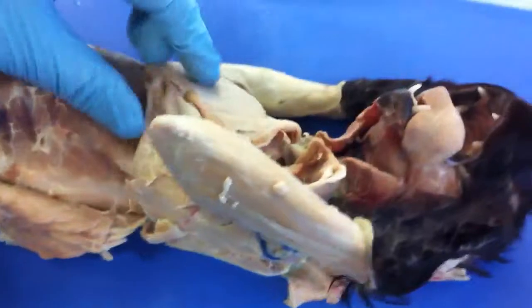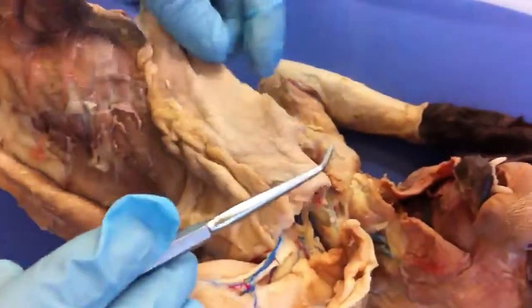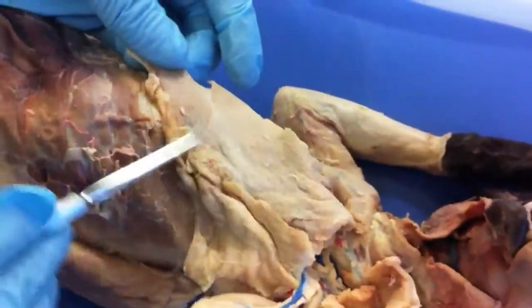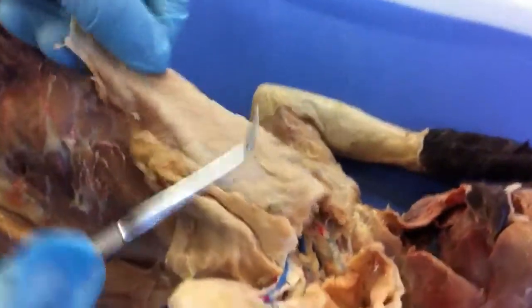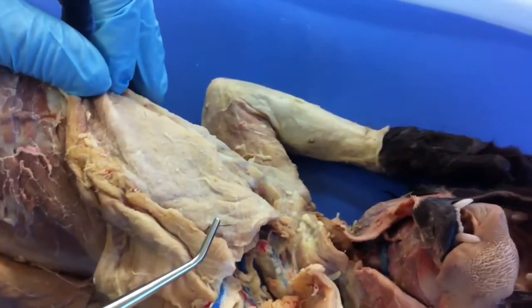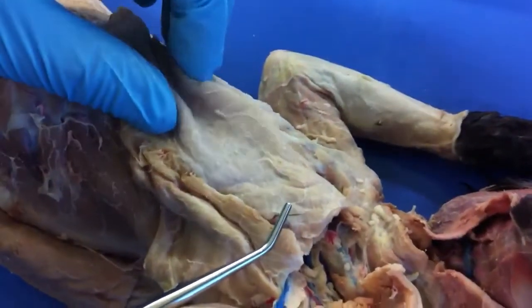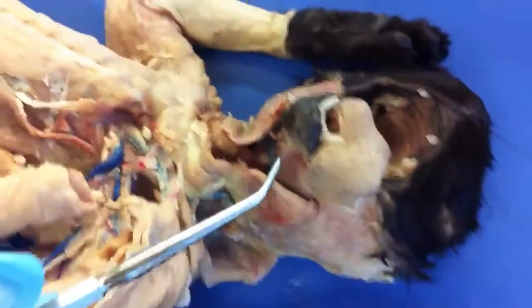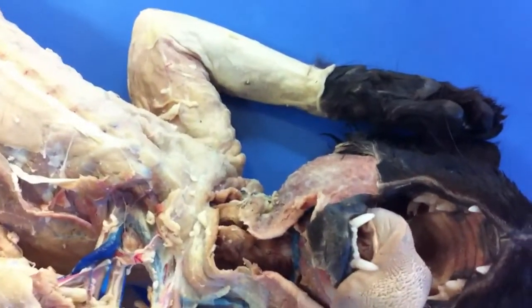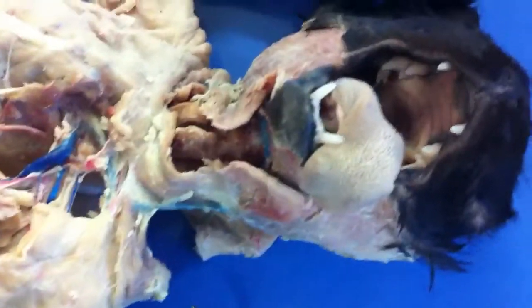Moving up to the chest, we have the pectoralis major, which we reflected — it's that big flap of skin. The pectoralis minor is right there as well. We have the sternohyoid, which is a main band coming up into the sternum.